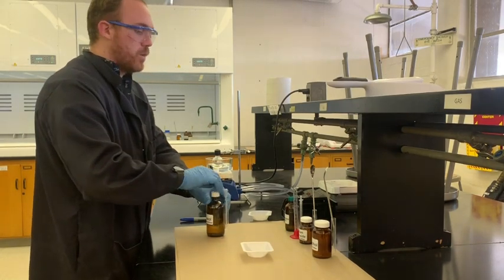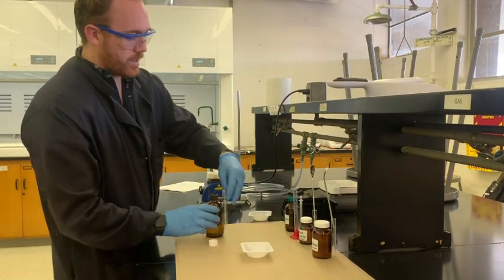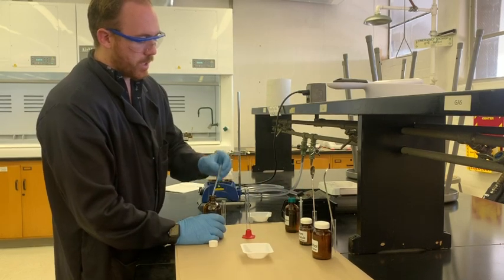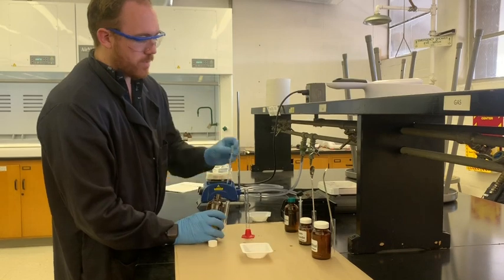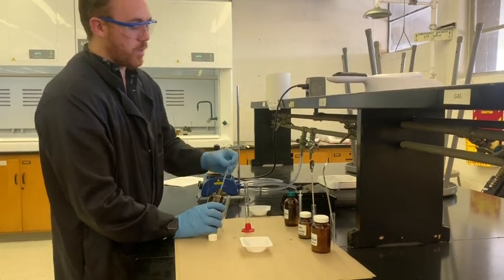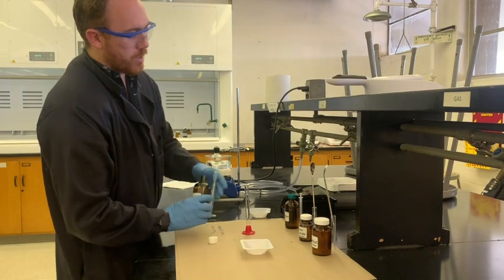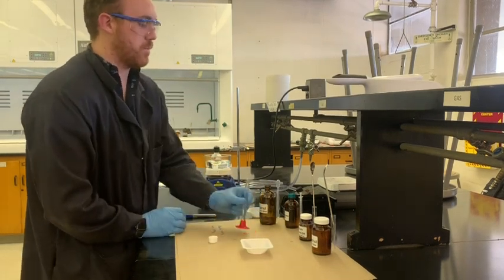Next, you just have to get started with a little bit of this ethanol. We've got 10 milliliters we're going to use here. It's a little bit over 10 milliliters, but that's fine. It doesn't really matter that much.